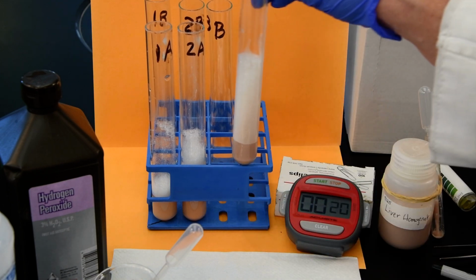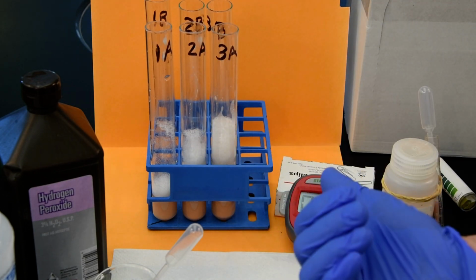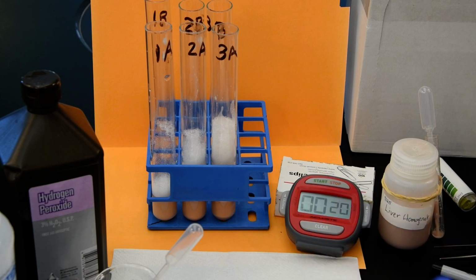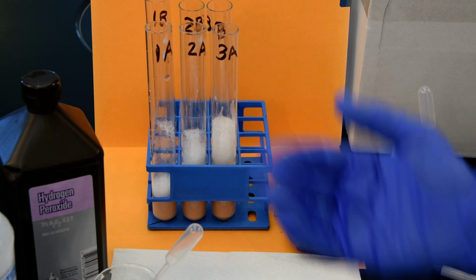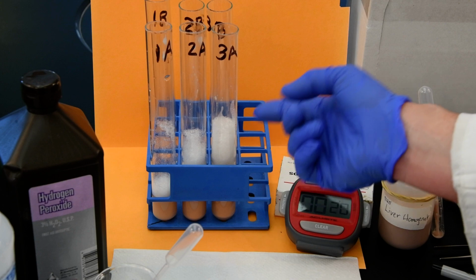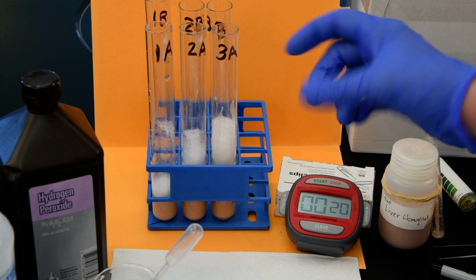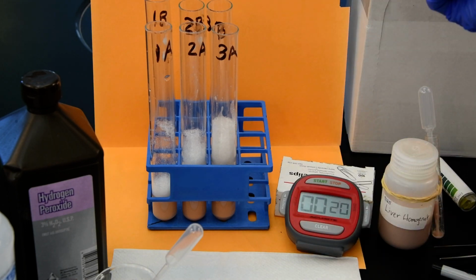So I always tell students to think about that too, because oftentimes they get a variety of different results that are somewhere along the lines of what we just demonstrated here. But you do need to think about how this would actually work in a living system. So again, there's an effect of increasing the volume, which we assume is concentration as well, but we don't really know that for sure, and we got more product. But we couldn't continue to add more and more enzyme and constantly see more and more product if we kept the reactant the same, if we just kept adding the same amount of substrate, hydrogen peroxide.